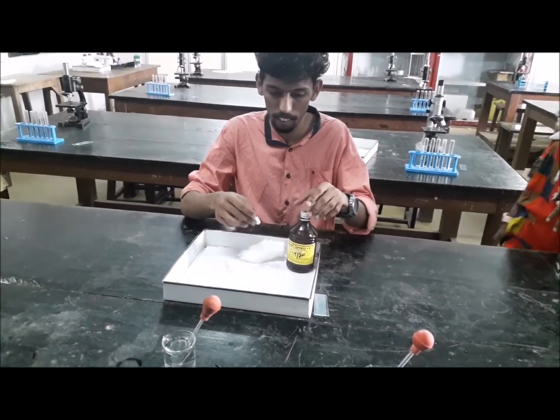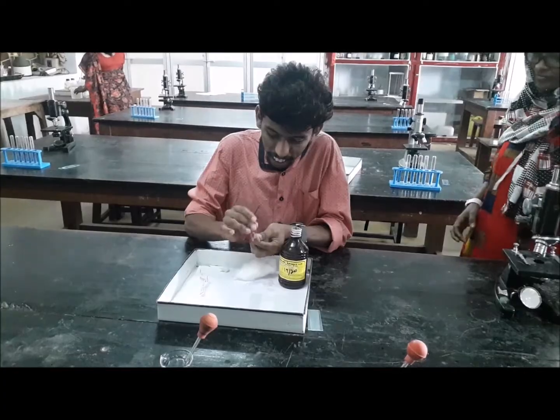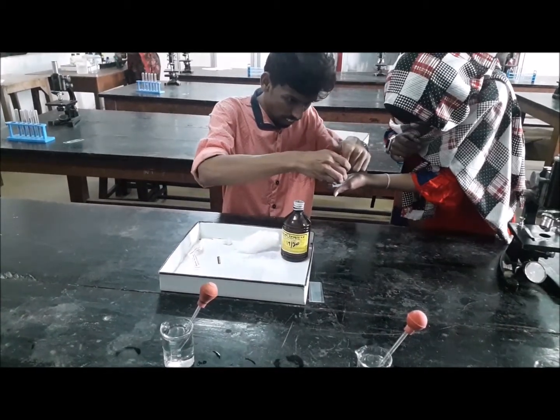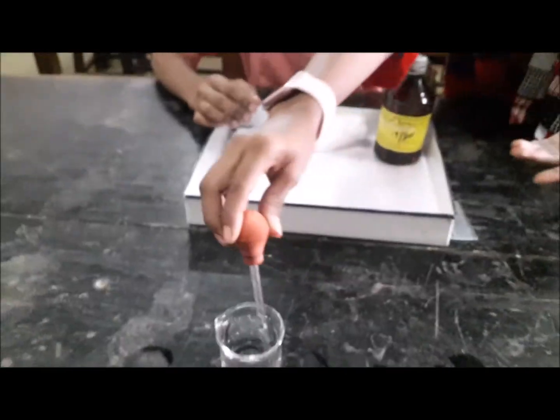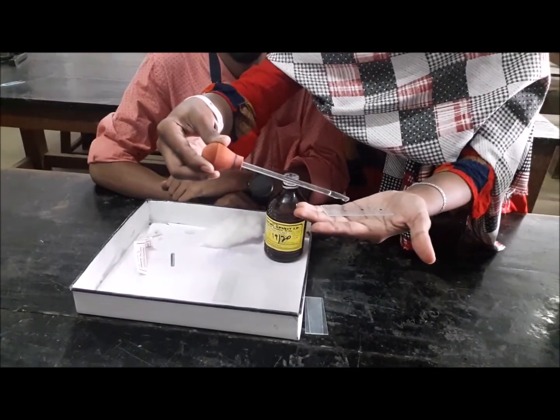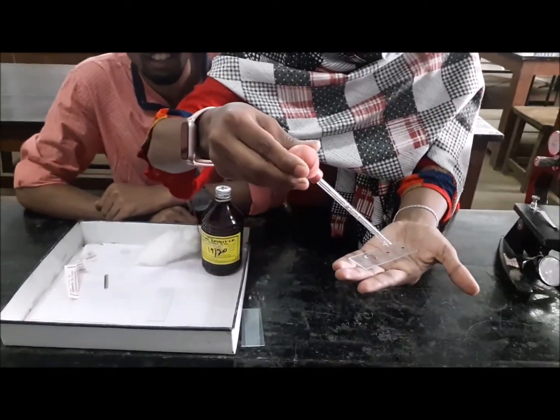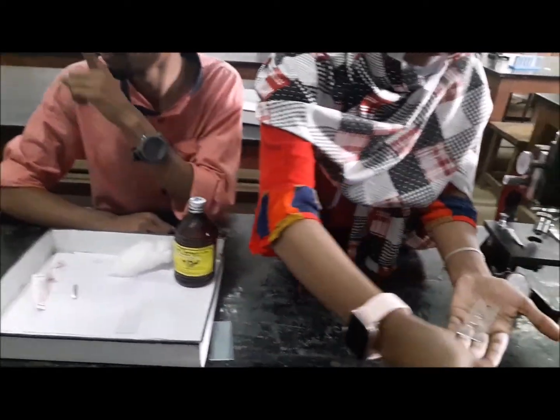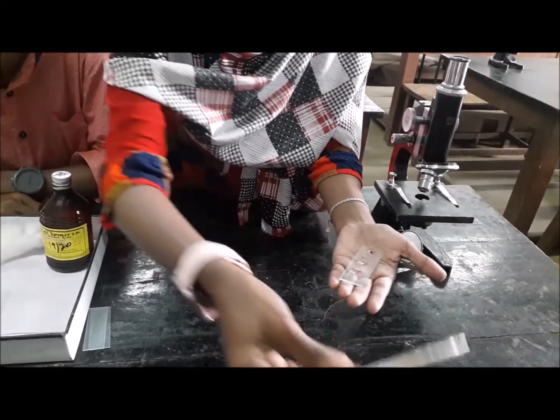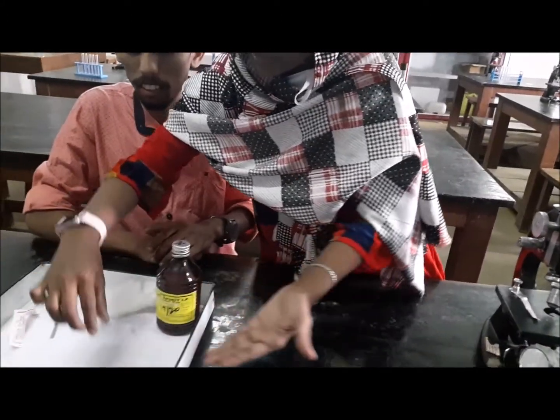Wipe the tip of the index finger, prick with a needle, take 3 drops of blood on a slide, add 1 drop of hypotonic, isotonic, next hypertonic solution and keep it for 20 minutes.